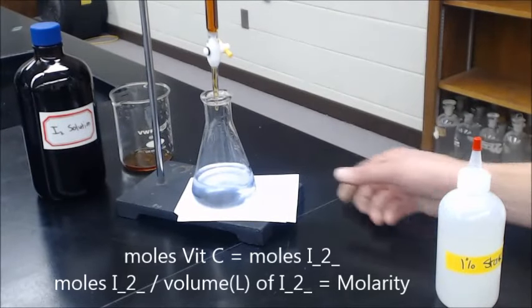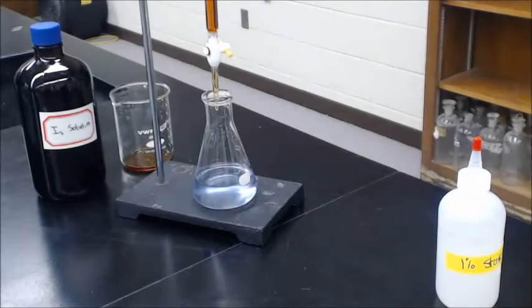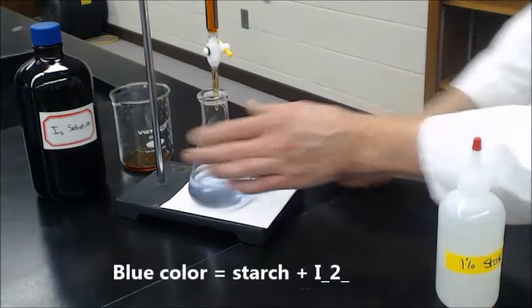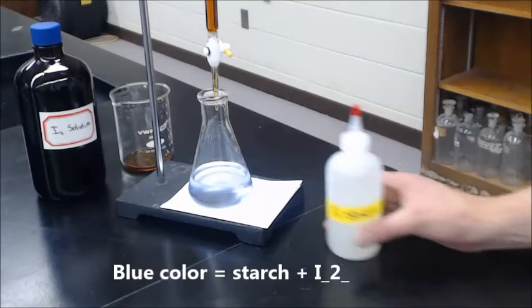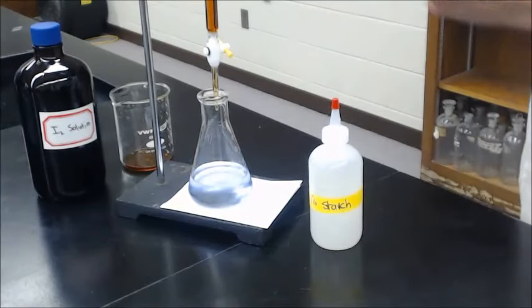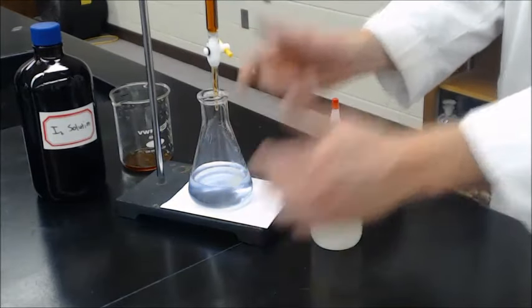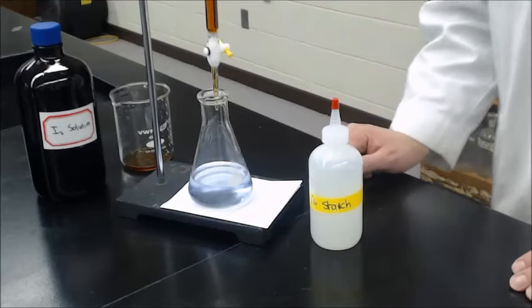At the end you now have equal moles of iodine and vitamin C that are in there. The end of the titration, the titration has been completed.